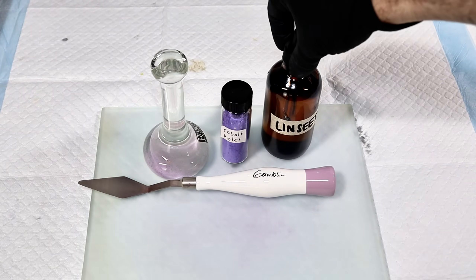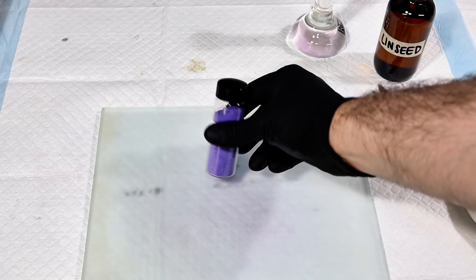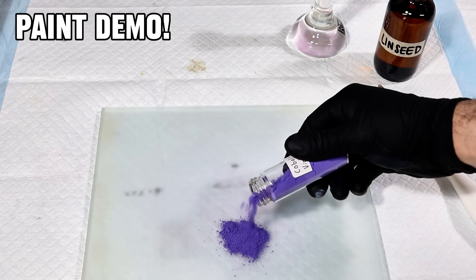This is because cobalt ammonium phosphate is somewhat soluble in acidic or alkaline mixtures, and is least soluble between a pH of 6 and 9.5. However, if you want to make regular cobalt phosphate with no ammonium, you can simply maintain a pH of 12. Anyway, now that I had my final pure cobalt violet, it's time to see how this stuff works as a paint.